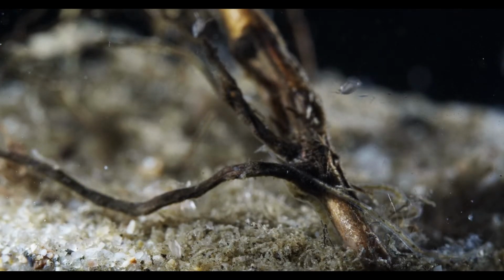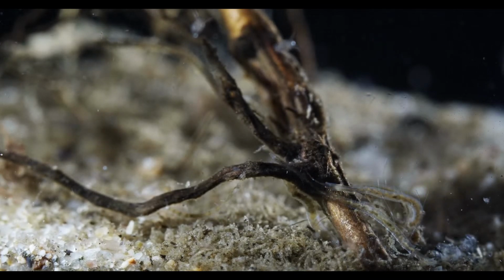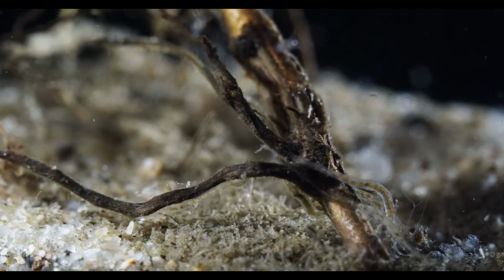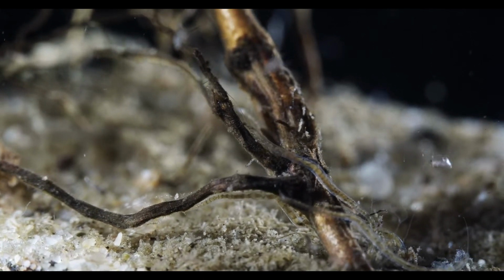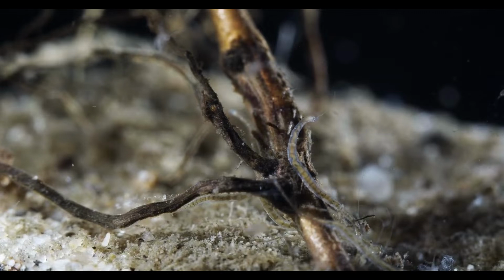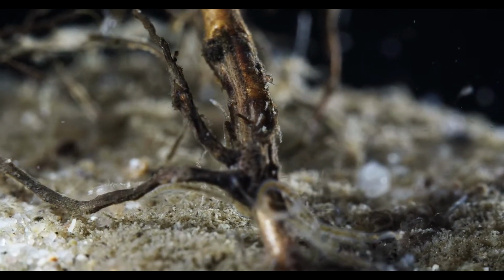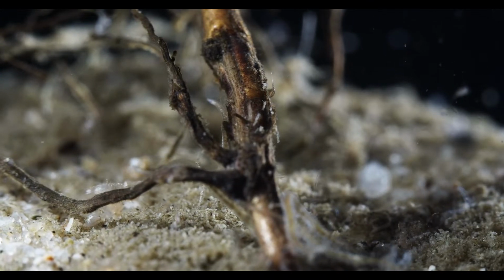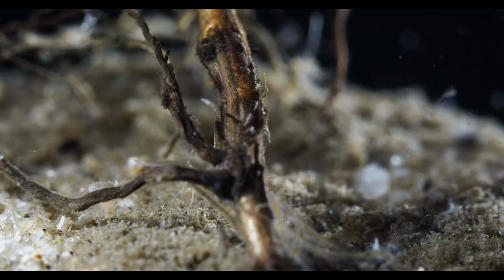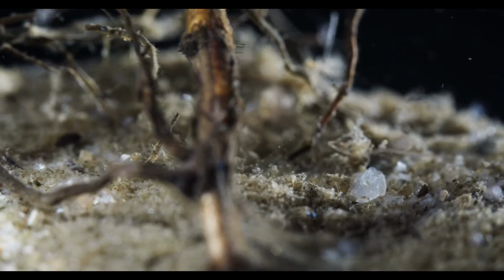I mean, I know they do exist in pond water, but I have never observed one. I should be able to see them with the magnification I get. Haven't used my compound microscope a whole lot this last time, the last period here.